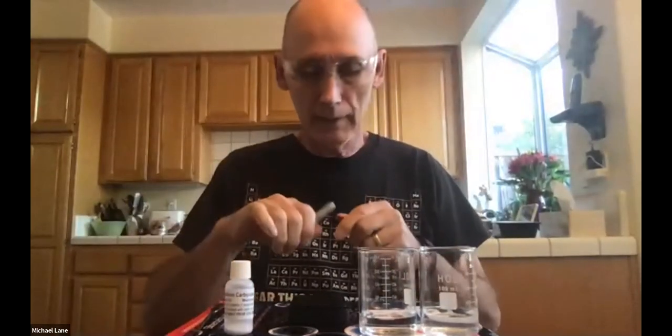And I see there's one other thing that I didn't have. Excuse me while I reach back here and get myself a Sharpie. Particularly helpful in any laboratory setting. It's one of the few things that you can use to write on glass. So I want to write on here that this is my calcium chloride. All right, so that's my calcium chloride. If you can't read that, don't worry about it. Just know that I've written calcium chloride on there.